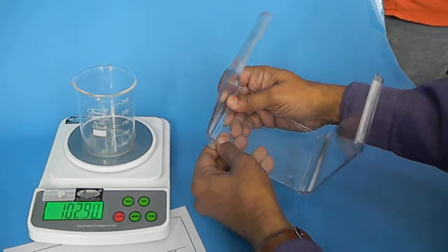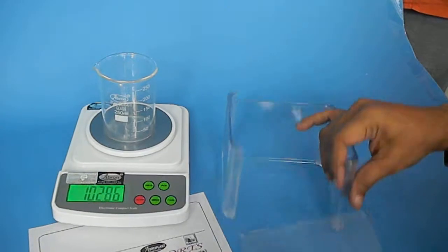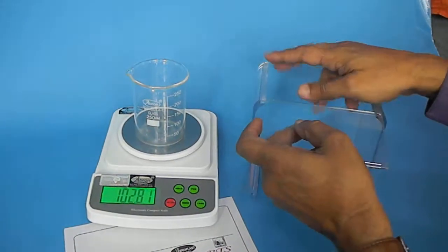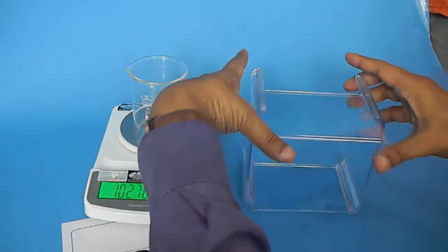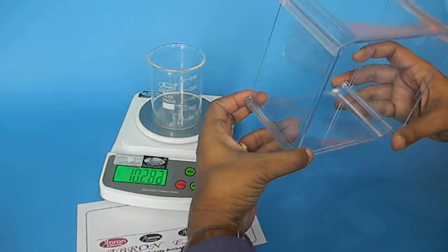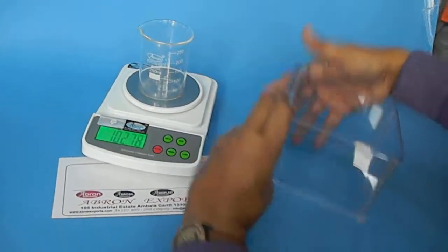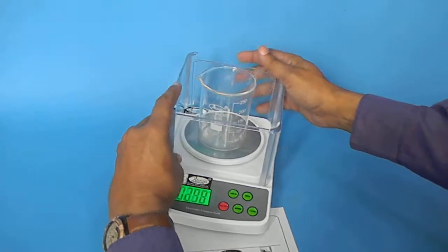When you slide it, it goes inside. Similarly, there is sliding here, and fitting is very easy. Just push it from all sides and it fixes, then you put it on the top.